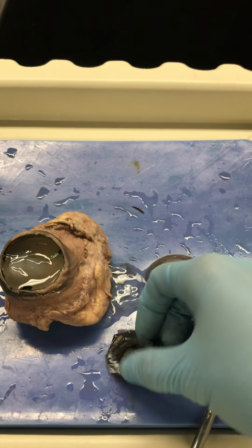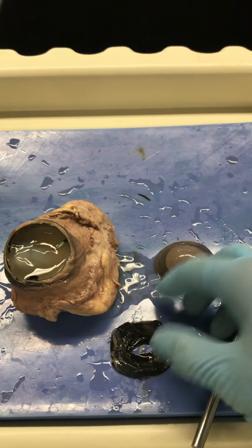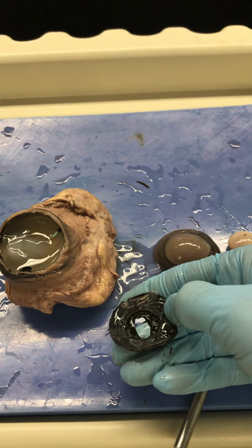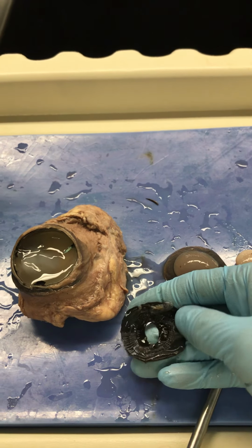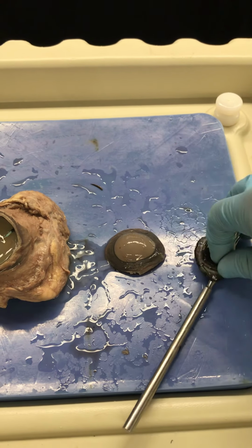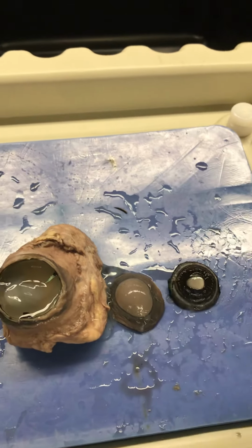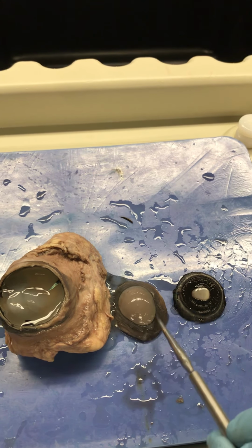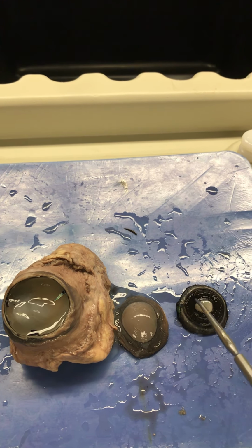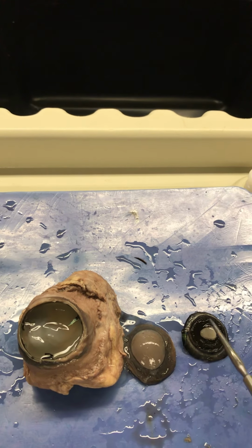And they've got this neat kind of undulation, like the gills of a mushroom pattern. Those are those ciliary bodies that will connect to the lens and help the lens to stretch as well as accommodate for farsighted or nearsighted vision. So cornea, sclera, the pupil is the hole, the lens is the marble behind that hole, and then this is the iris.